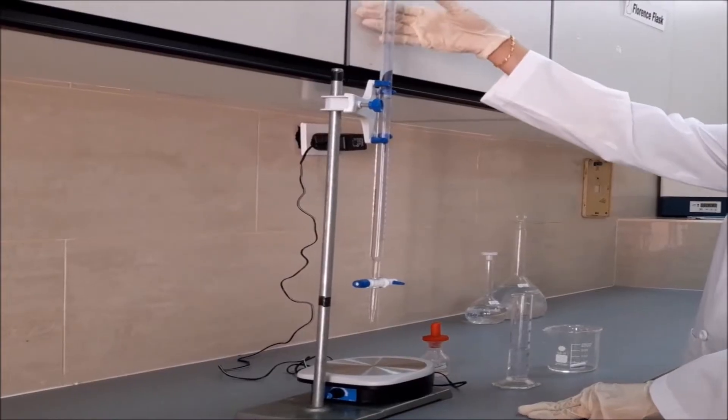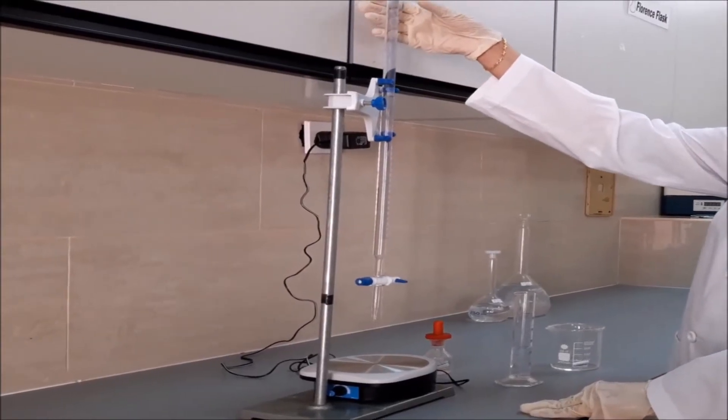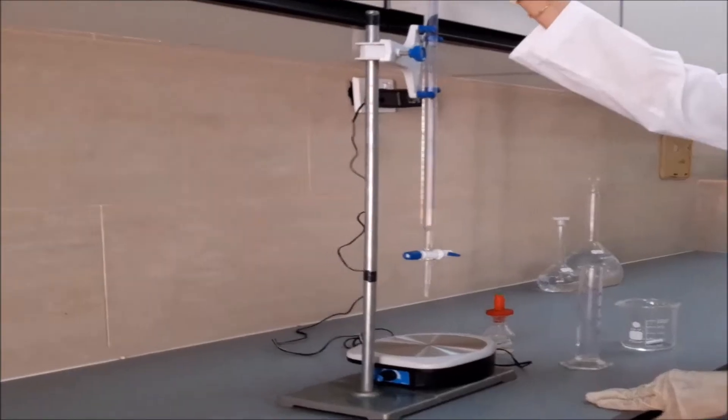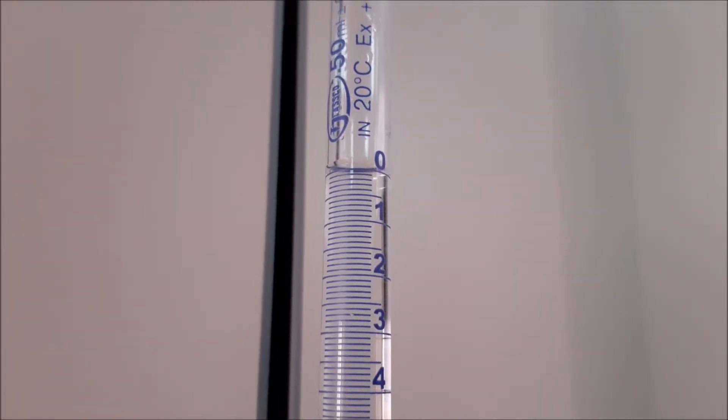I put sulfuric acid in this 50 ml burette. Make sure that it is level at zero.